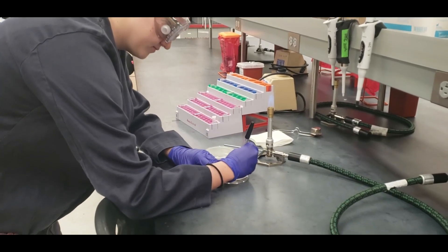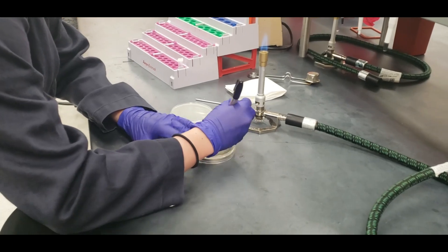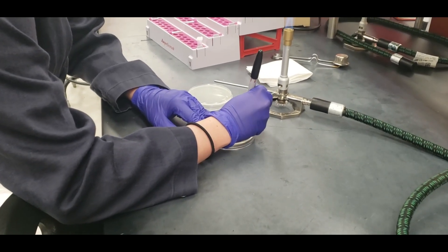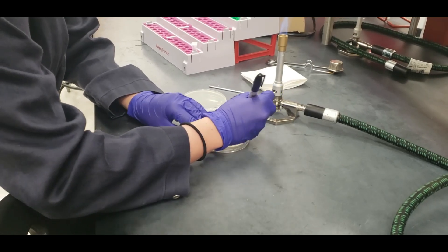You're going to repeat these steps just like you did for making your three-quadrant plate. You're going to label your plate properly: name, date, TA, section, time, and specimen.